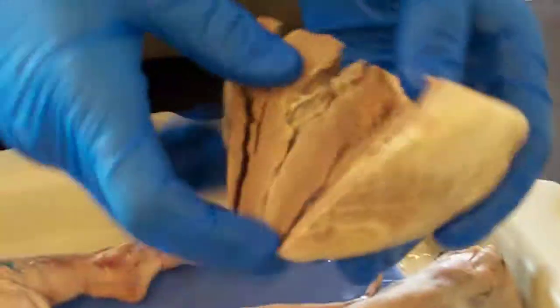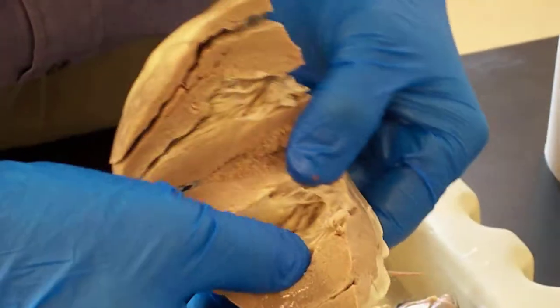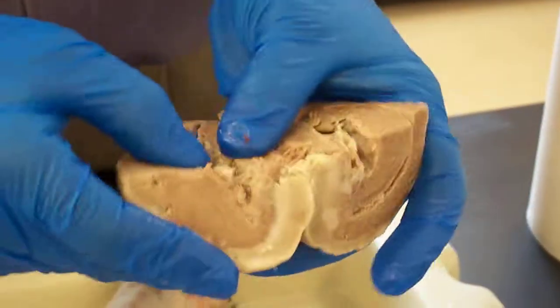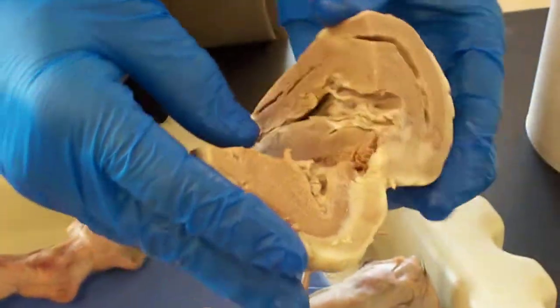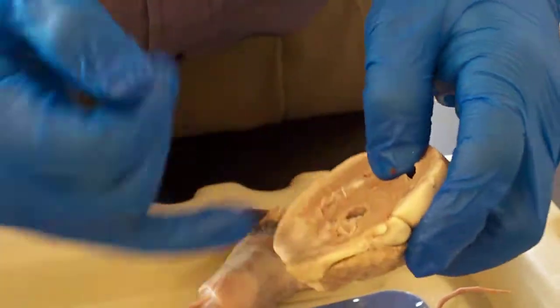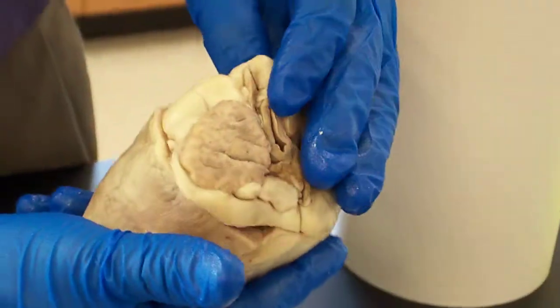The semilunar valve may be from the section that's missing. Not seeing the aortic semilunar valve — it might be on the top here. Here's our aortic semilunar valve. I know that's kind of difficult to see. Let me put this together.